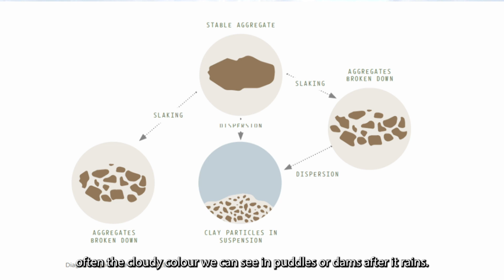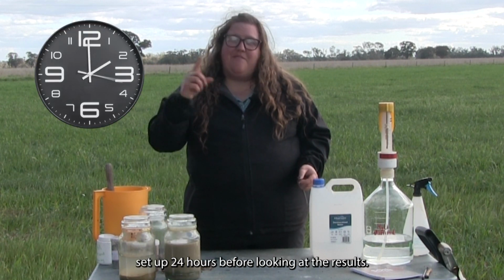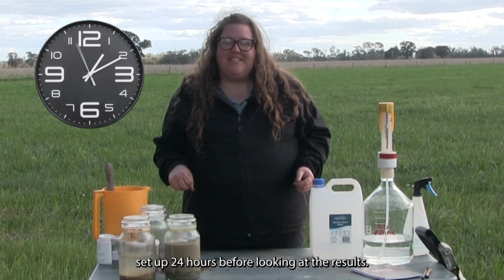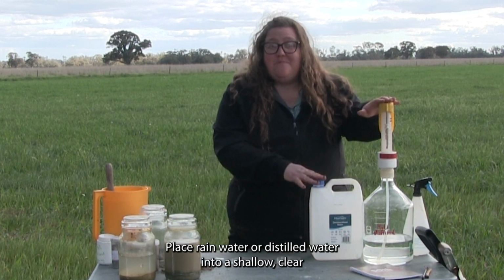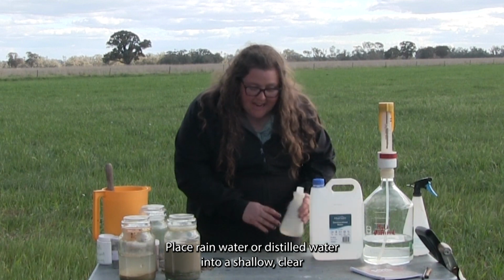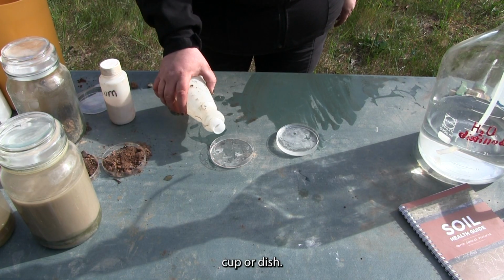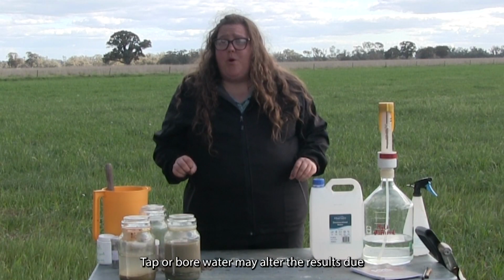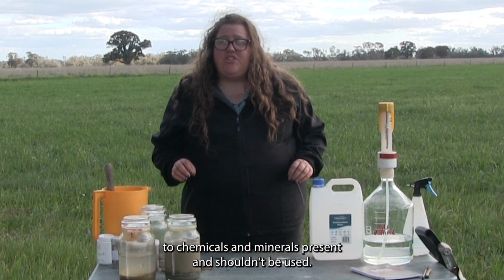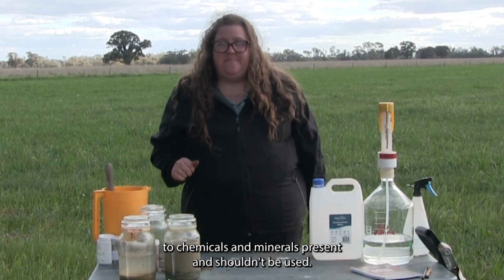The test for soil stability is best set up 24 hours before looking at the results. Place rainwater or distilled water into a shallow, clear cup or dish. Tap or bore water may alter the results due to chemicals and minerals present and shouldn't be used.